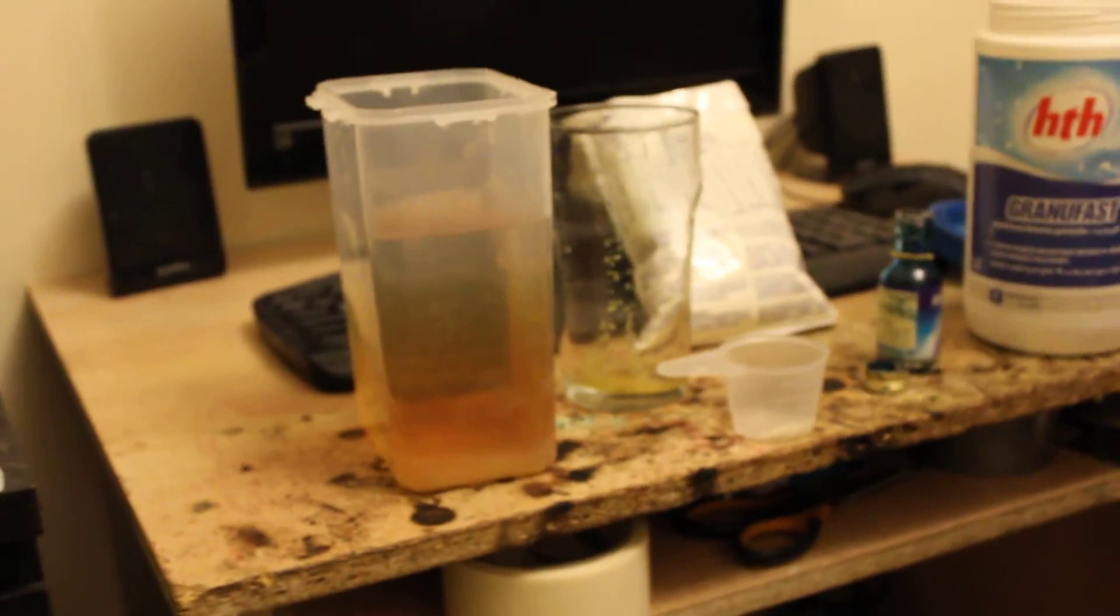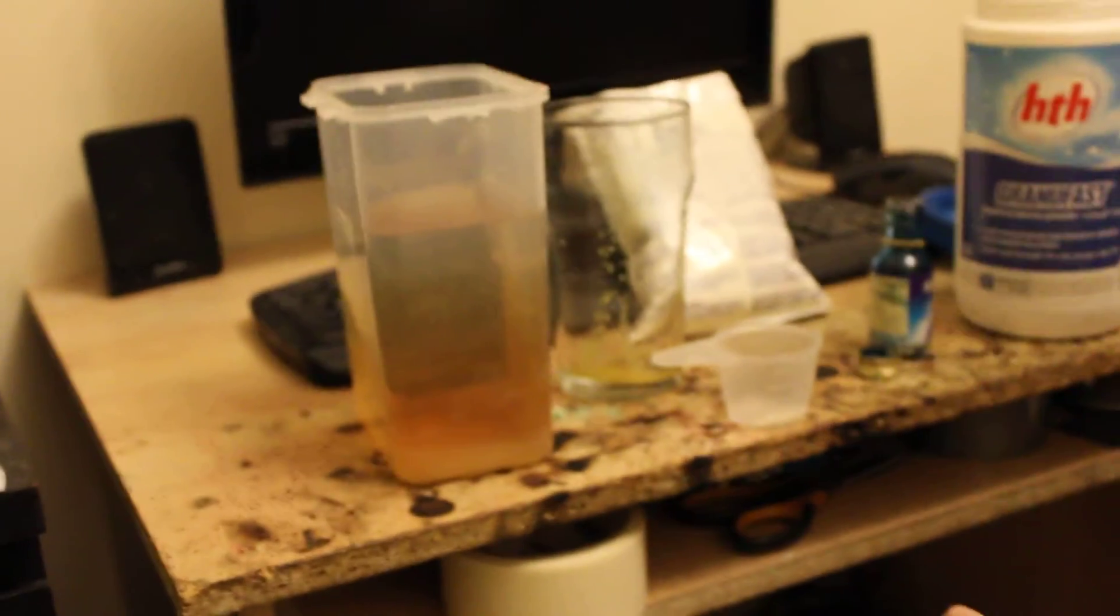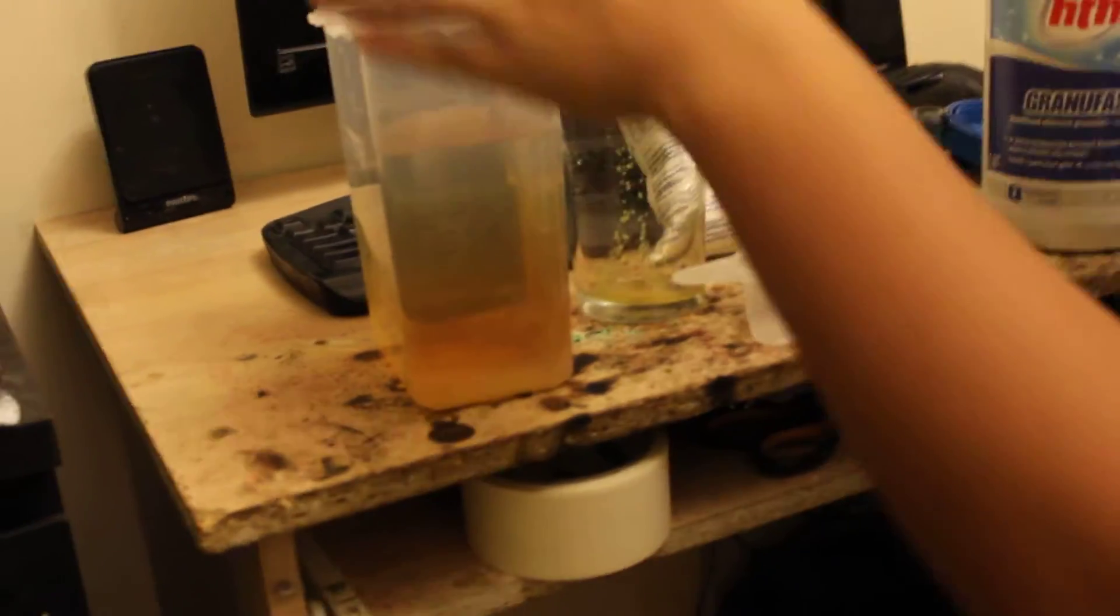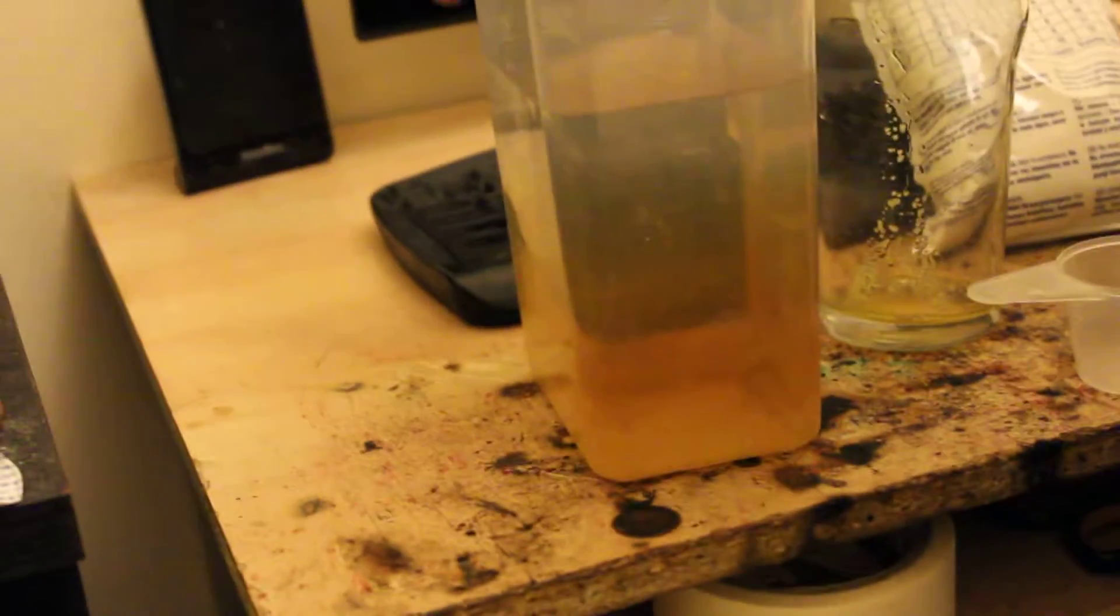Now you're probably thinking, wait, what if you just diluted it and that's the only reason it changed color. Well, let me get some more water. Just dump this in here. Just wash it with tap water.